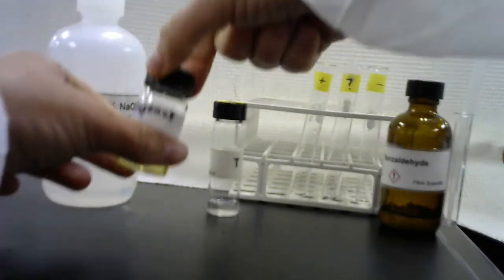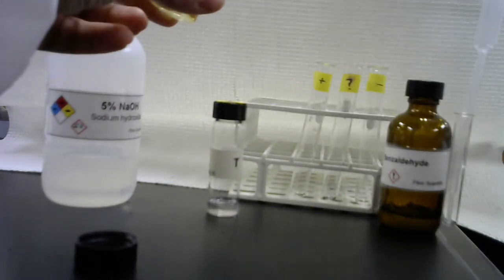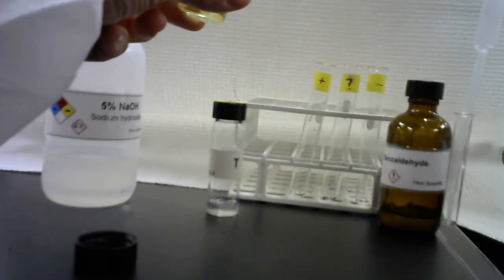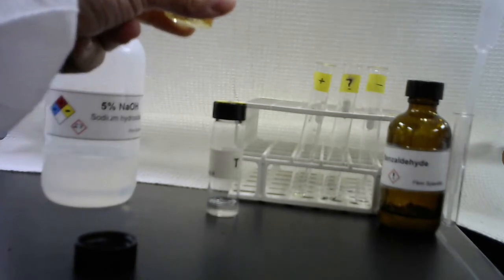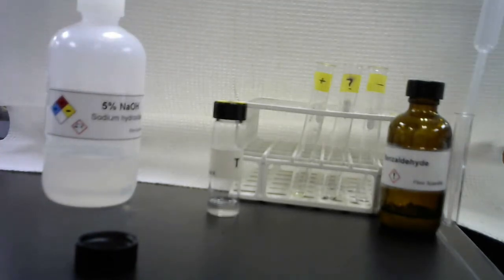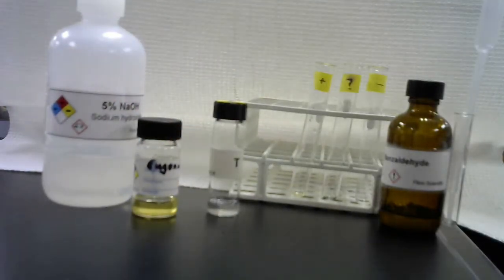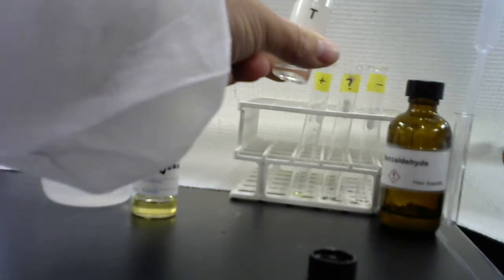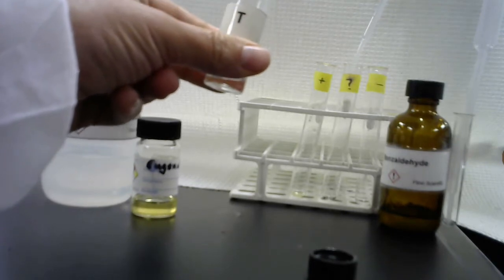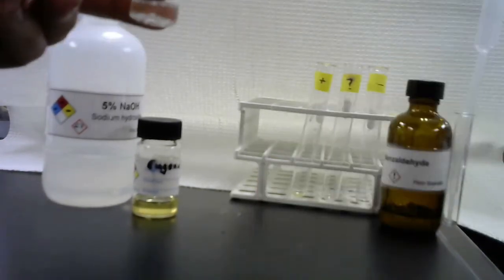So just like the water solubility test, you'll add a few drops of the substance that you're testing to the test tube. Eugenol is known to be soluble in sodium hydroxide solution. So to the known positive test tube, I'll add a few drops of eugenol. And unknown letter T is the one that we're testing. I don't know if this is soluble or not soluble in sodium hydroxide. So we'll add to the question mark test tube 3-4 drops of unknown letter T.